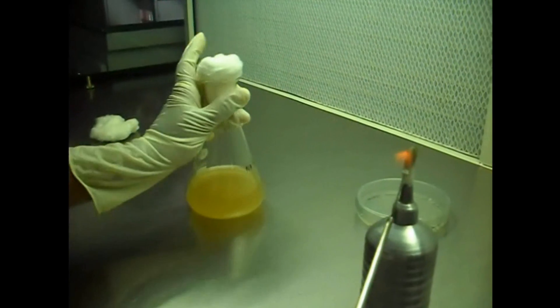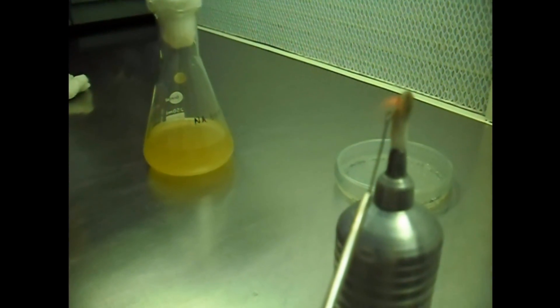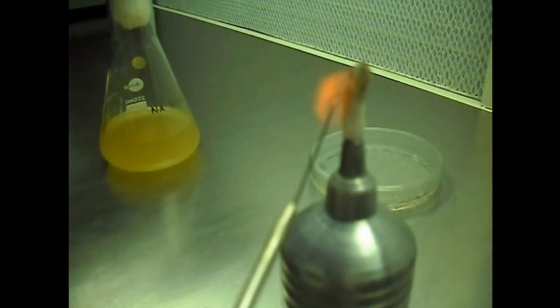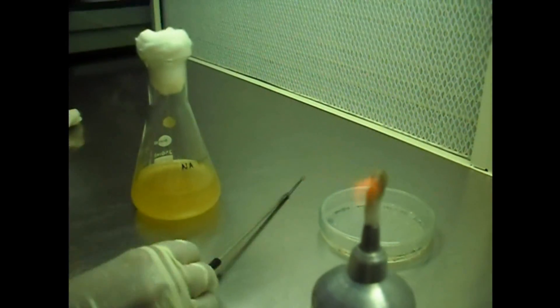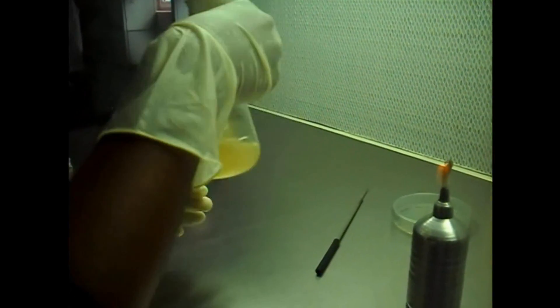Again, red hot the inoculation loop. Shake the broth well.